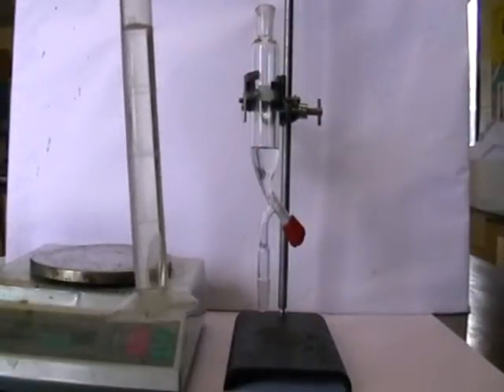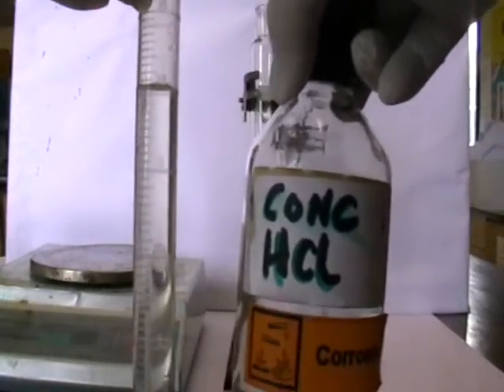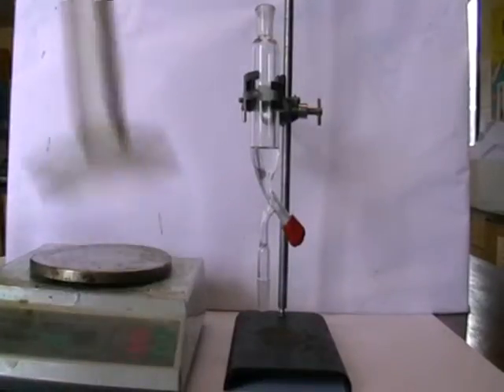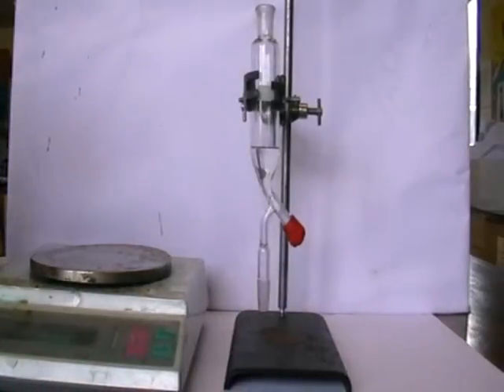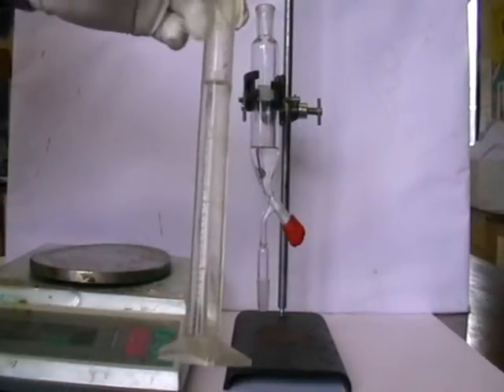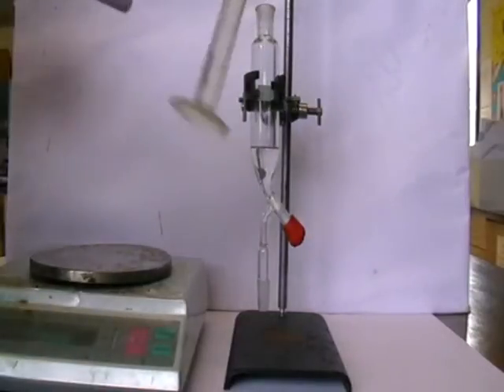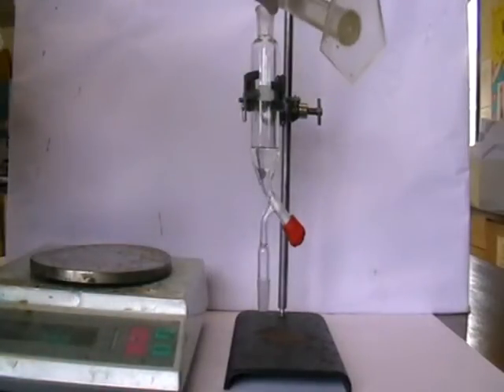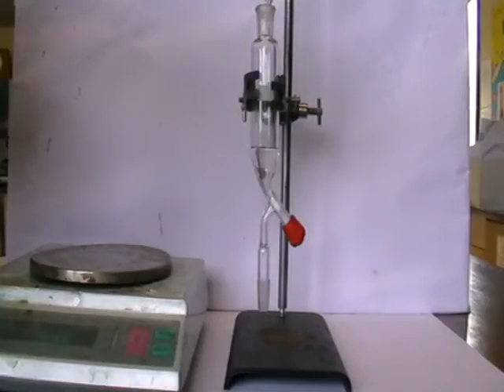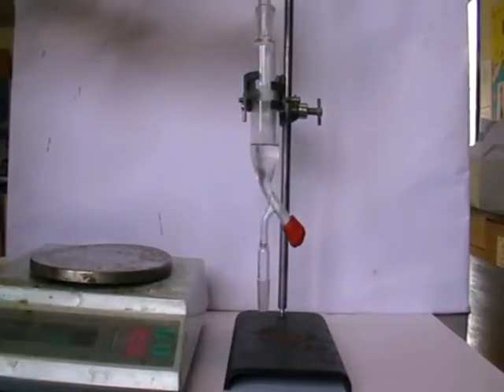Here I have the other reactant — concentrated hydrochloric acid. I have measured out 20 cubic centimeters using the measuring cylinder. The concentrated hydrochloric acid will be in excess, so the precise volume is not necessary, so long as we know it's clearly in excess. What I'm now going to do is add this slowly, about 3 cubic centimeters at a time, with shaking. In goes the first 3 cubic centimeters very slowly — let it run down the inside edge. I now place a stopper on this.